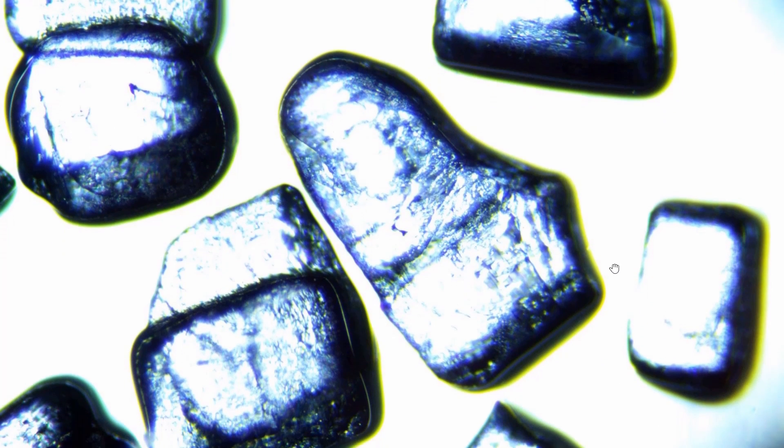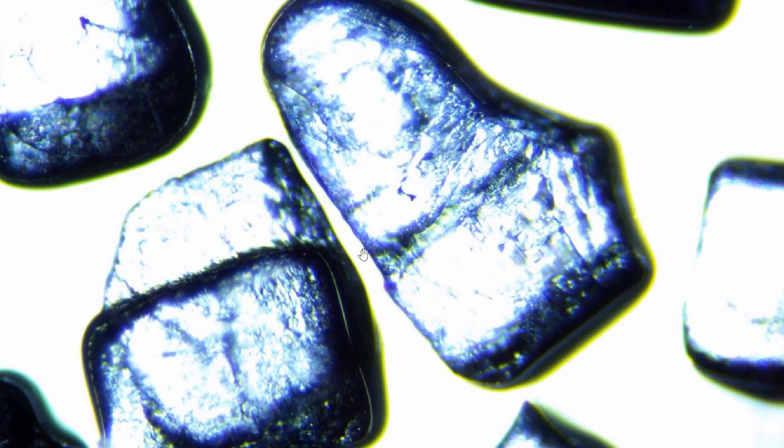At low magnification the salt crystals look relatively normal — they're semi-dissolved so they're a little bit rounded. But when we zoom in we can see the purple and yellow fringing. On the left corner there is a yellow discoloration and on the right corner it's a purple-blue. This is visible everywhere there is a stark contrast between bright and dark. The fringe is probably around five or six pixels in diameter, so we are already way beyond the resolution limit. If you don't zoom in, or don't know what you're looking for, you might not even realize this is an issue.